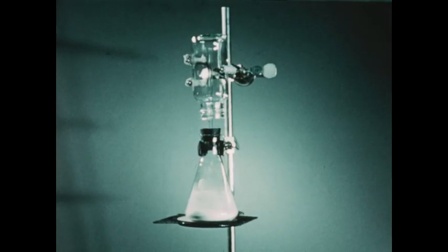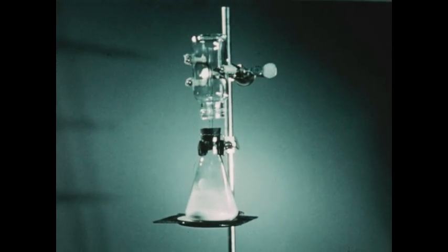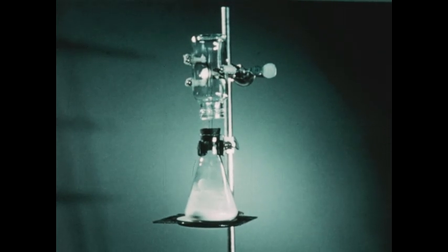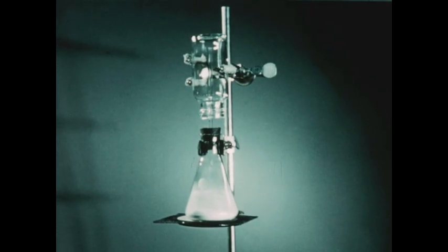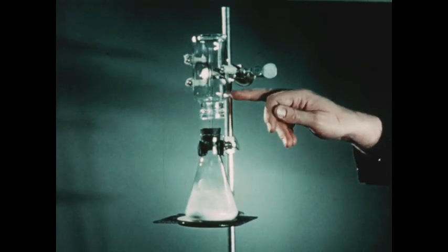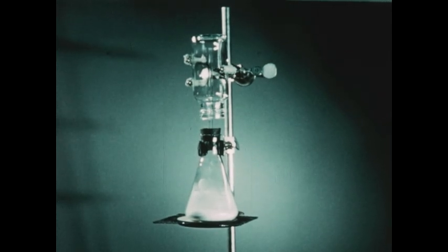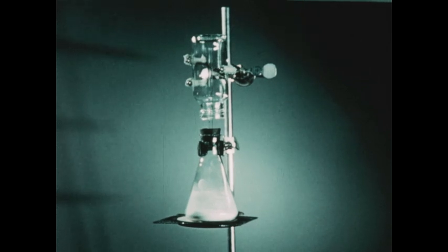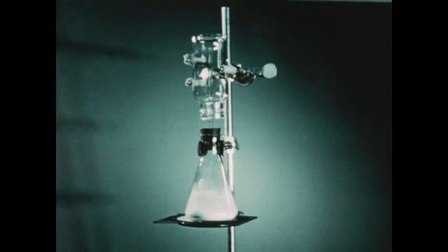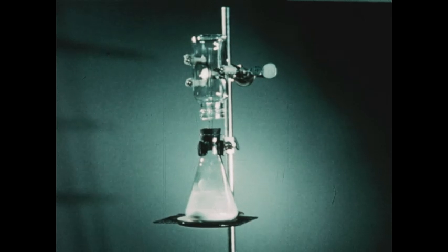We are now utilizing the principles illustrated in the preceding experiment for the production of ammonia gas in some quantity for laboratory use. In the flask, we've placed a mixture of ammonium sulfate and calcium hydroxide. We're heating this with the Bunsen burner. NH3 will be evolved, passed through this glass tube, up into the bottle. Since ammonia is considerably lighter than air, having a weight of 17 on the scale where air is about 29, we're collecting this gas by the downward displacement of air. We'll collect several bottles of ammonia and then use them to examine several different chemical properties of ammonia.